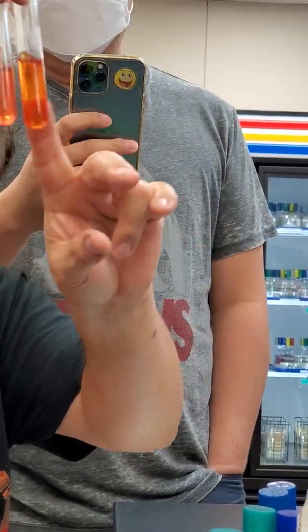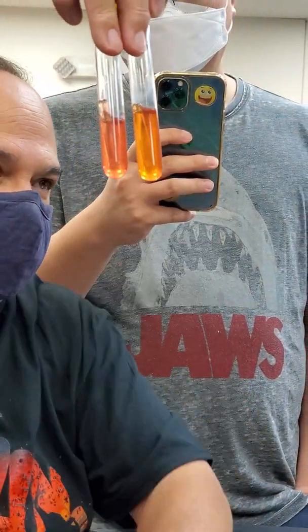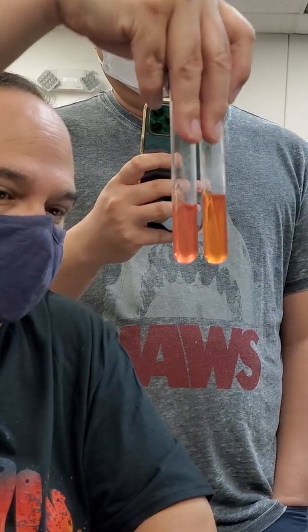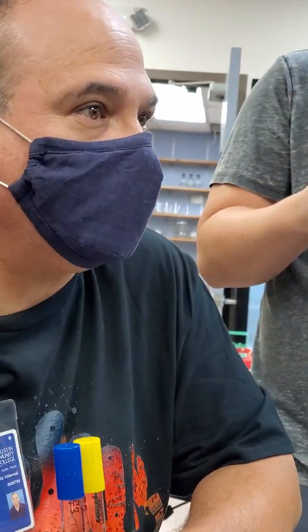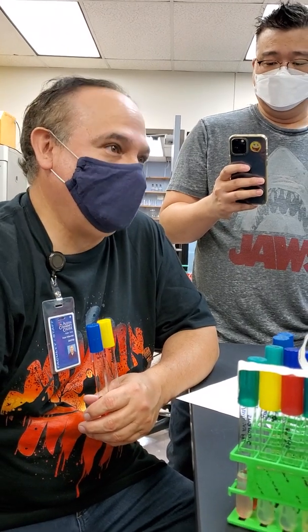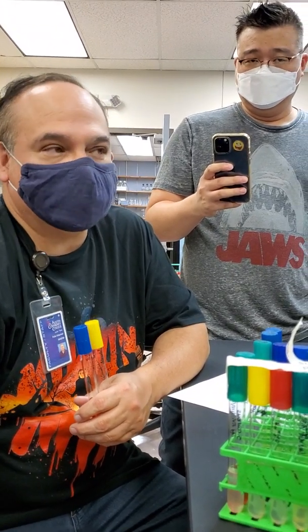This one is going acidic, so it's acidic. This one is neutral. There's no change here. So in practice, I would have to say you're looking at a red or orange color. I might say you're looking at something that appears to be turning yellow. If that's the case, it's going to be acidic.